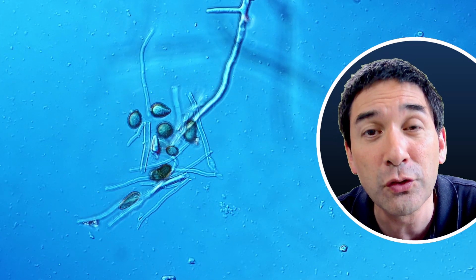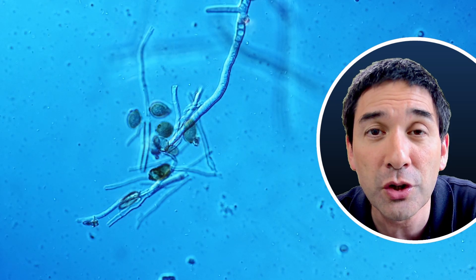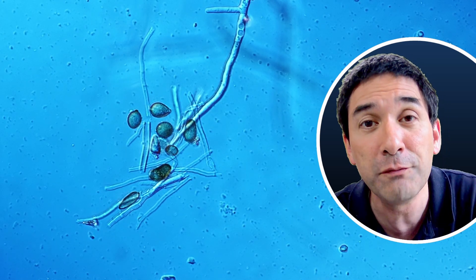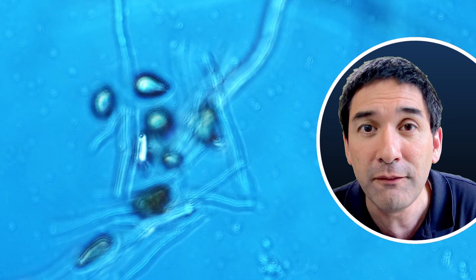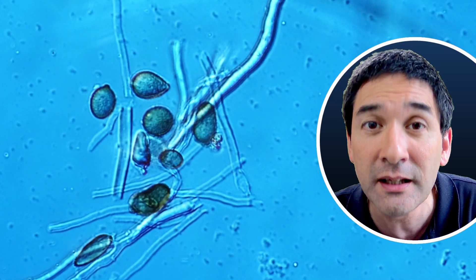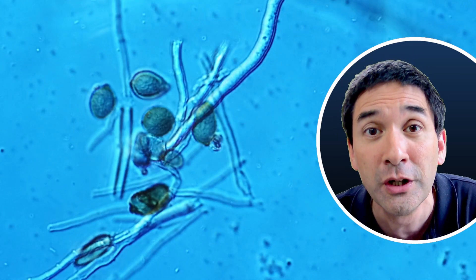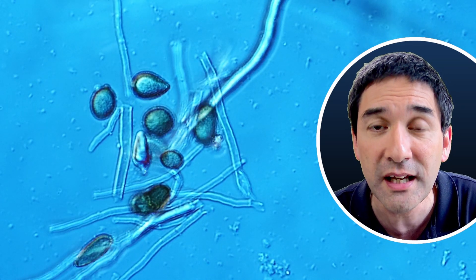Fungi are also able to form spores. Certain bacteria are able to form so-called endospores, which can withstand dryness and sometimes also high temperature, but those endospores are found inside the bacterial cell. The fungi here, on the other hand, form very large spores that are outside of the hyphae and can spread through the air or even water to other places to form a new fungus.